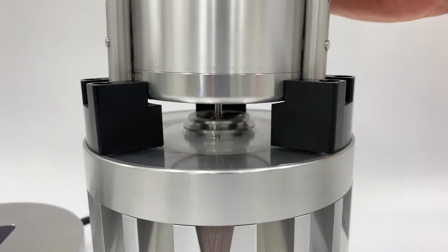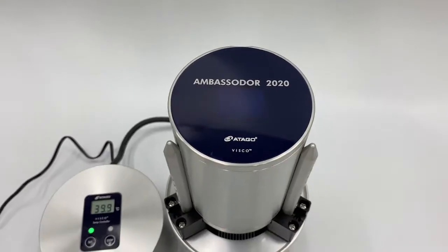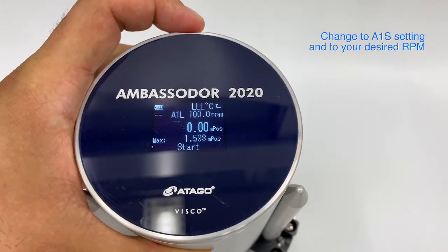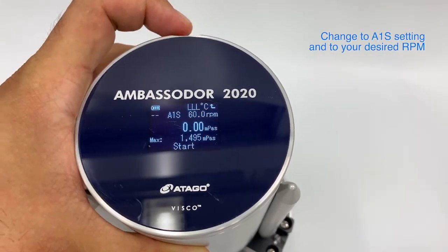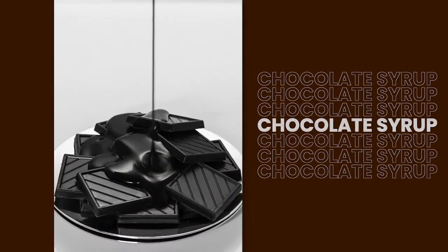The volume placed at the fill line should be exactly right for the spindle — it may come slightly over but should not spill. Make sure you're very accurate when filling to that line. We turn on the instrument and select the settings: A1s, which means A1 spindle with the small container. For chocolate specifically, the most commonly used RPM is either 10 or 20.